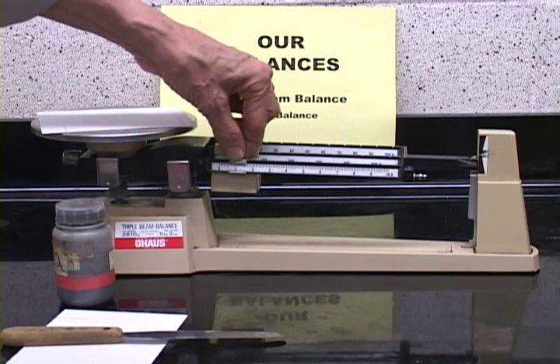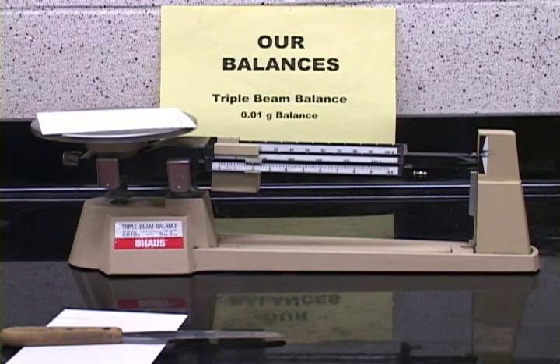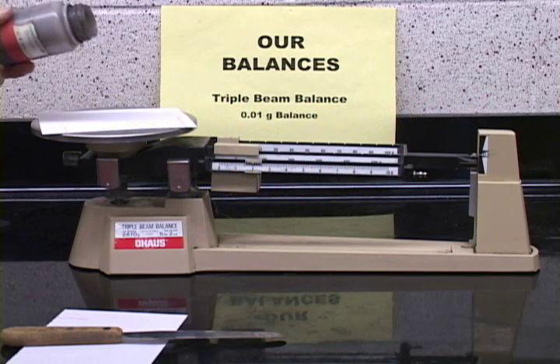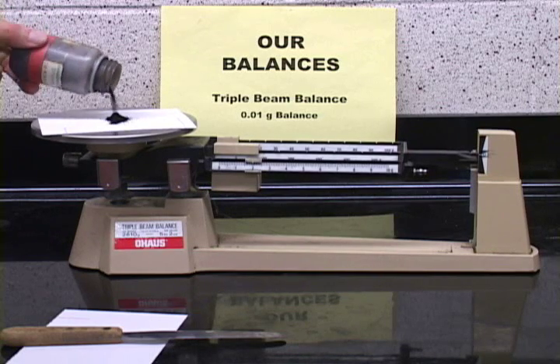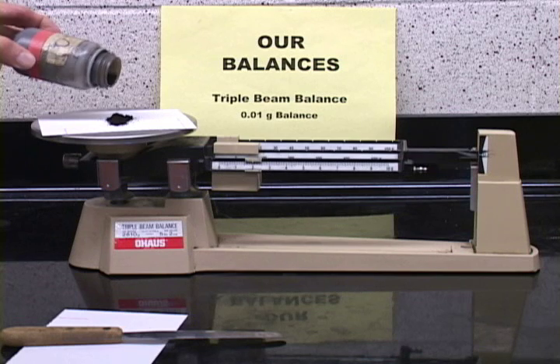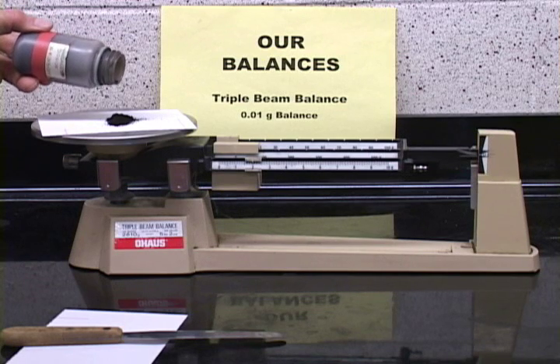We will weigh out 1 gram of our powder, so we will move this dial 1 gram. It was at 1.00 before, now it's at 2.00. And now we will add the powder that we're weighing out. We're weighing out 1 gram. And as you can see, use a rolling motion here. Tilt the bottle slightly, and then use a rolling motion. We're just about there. And a few more.